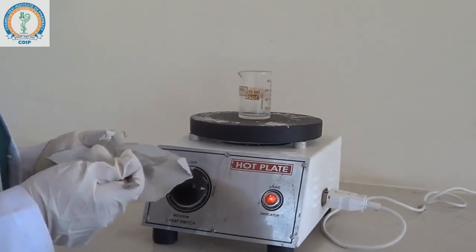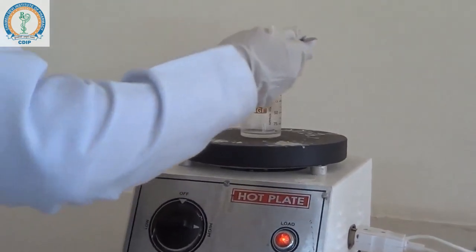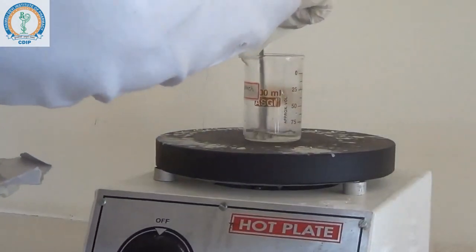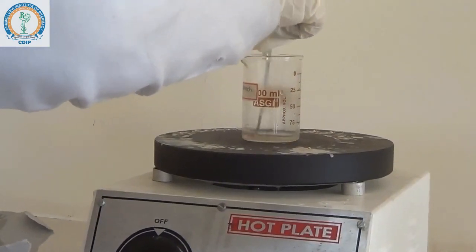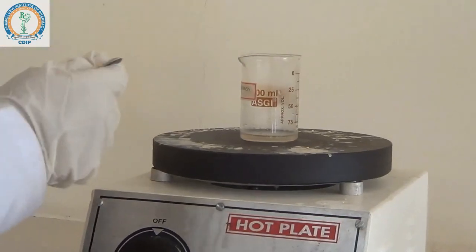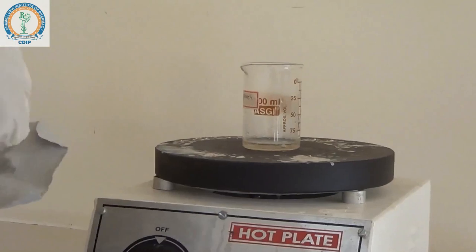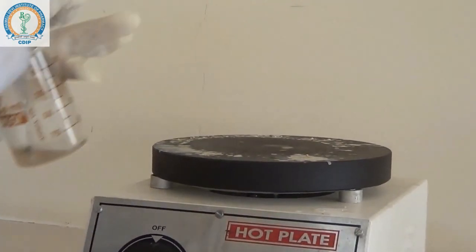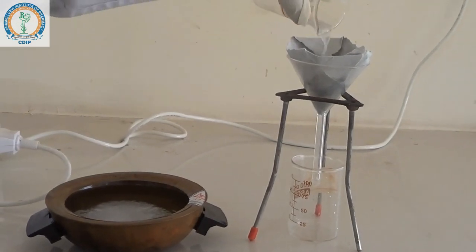Dissolve the crude product into the hot solution of ethanol and water. Now we have to filter out the solution.